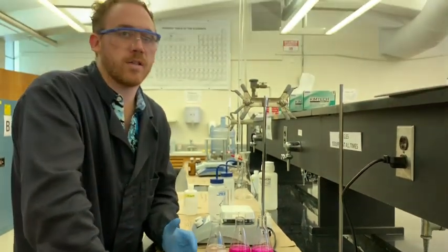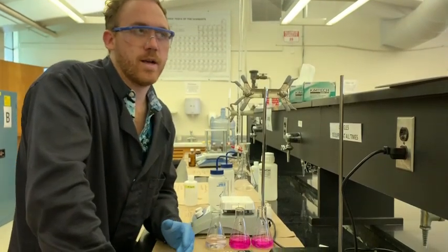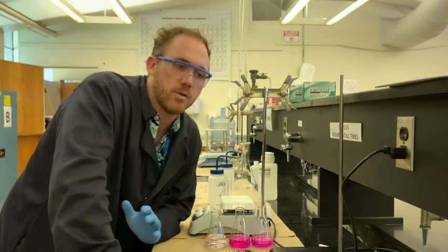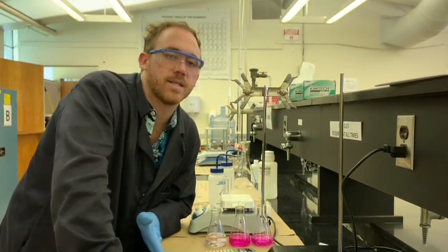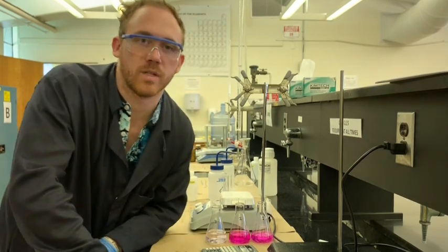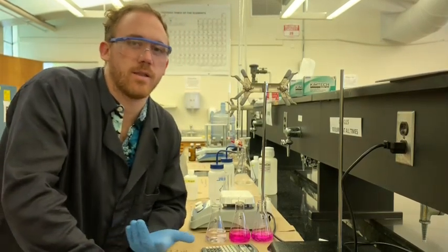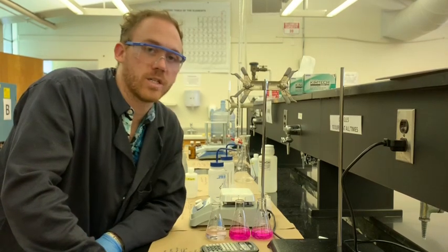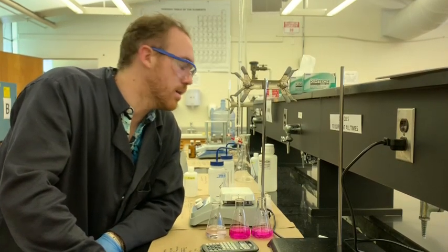If you're just on the edge, plus or minus 1 drop, it's still plus or minus 1 drop, so you're actually going to have good numbers. You shouldn't worry so much about the endpoint because it's actually a little bit further than the technical equivalence point. Usually the pH of phenolphthalein when it changes color is a little higher than 8.